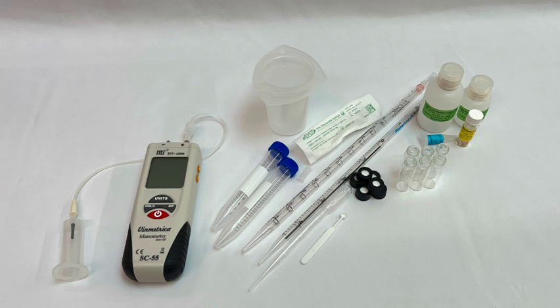If you believe your wine is at or near completion of MLF, we suggest you run the quantitative mode using the provided 0.4 gram per liter standard and your zero or blank. You also want to make sure that you perform this test at room temperature.